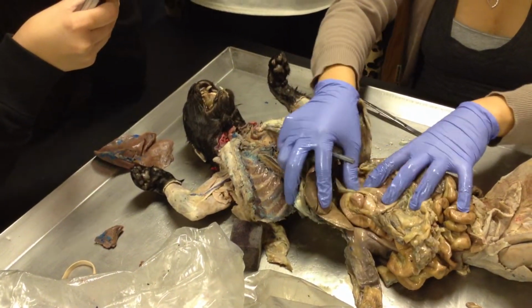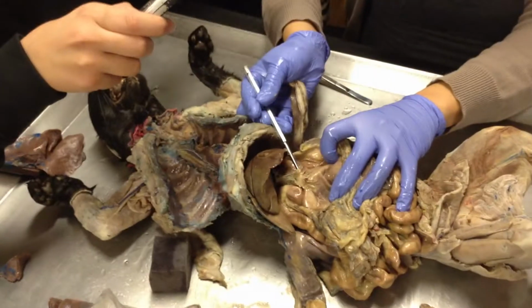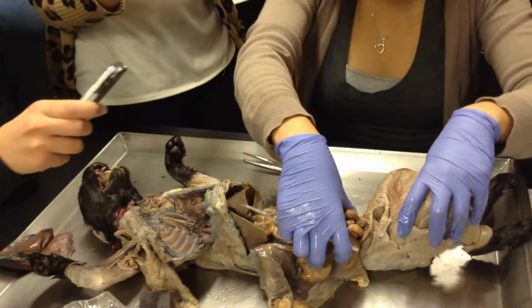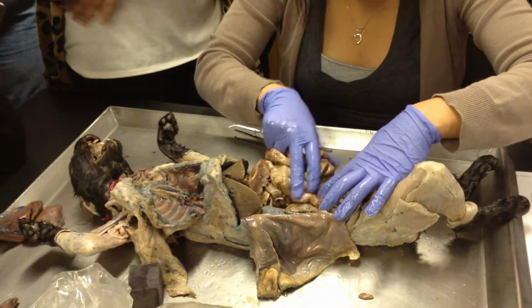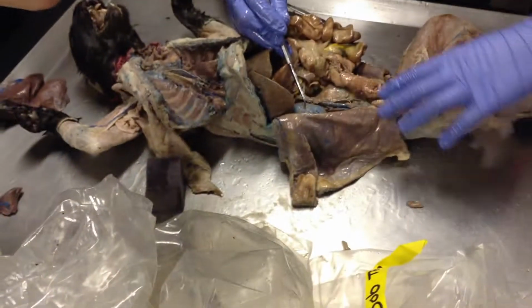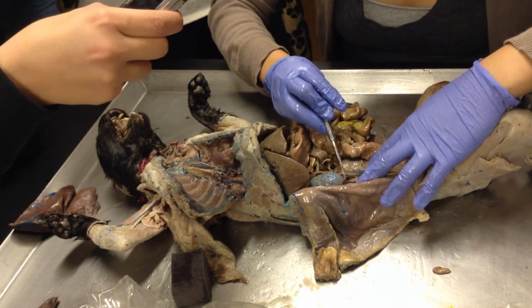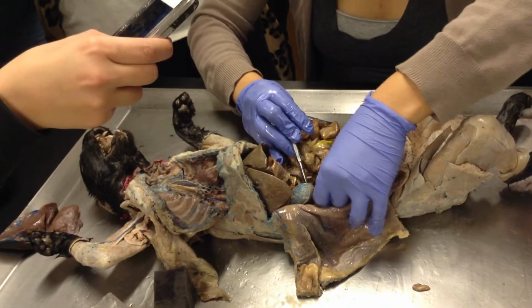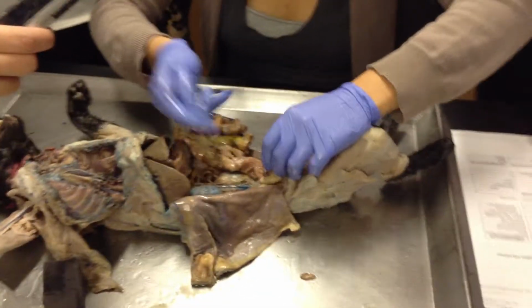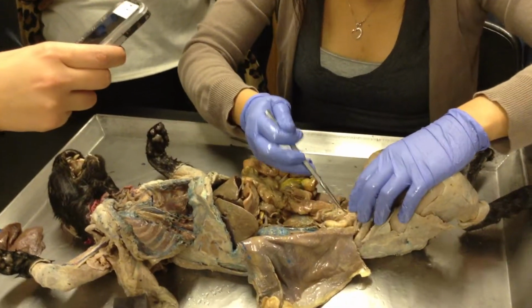So do you guys see on the stomach this region right here? Do you see it? Careful. Okay. Right. Know its derivations, right? Ventral mesentery. Okay. Do you guys see this guy? This right here is the what? The kidney. The tube that leads from it, that's this right here. Ureter. It's not supposed to be blue. It's supposed to be white. But that's the ureter, which collects where? Urinary bladder. This bladder right here, giant bladder. And then out through your urethra.